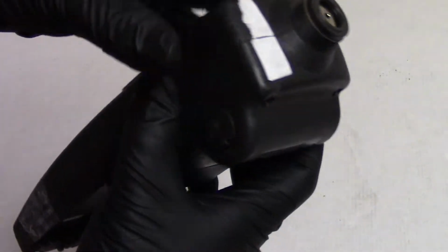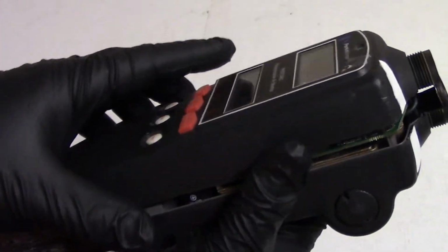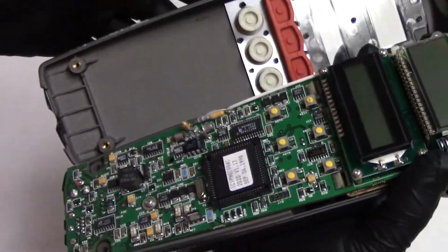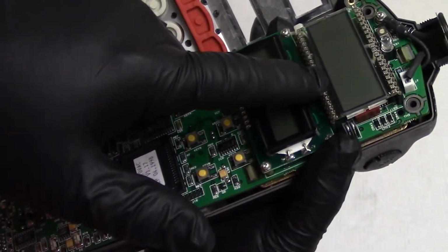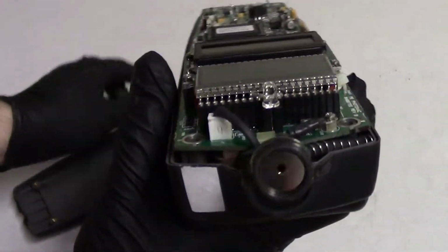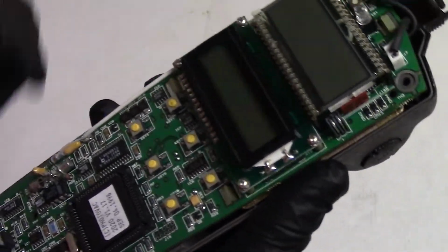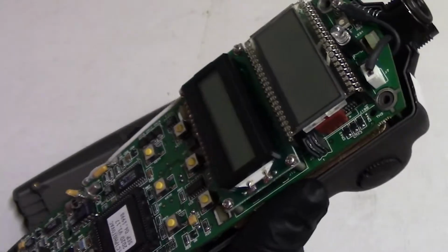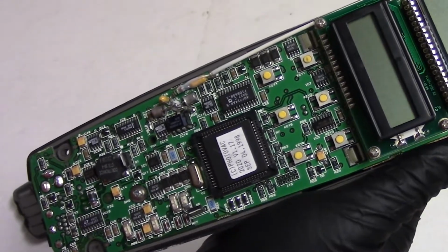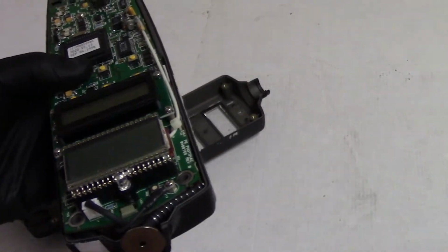Now, I've actually had this apart once just to kind of familiarize myself with things so that I didn't bumper around and fumble too much. But when I first took this apart, the LCD panel, there's our first view of the inside. This panel was sticking to here, and it pulled up and out, and a bunch of the legs that go into those sockets were actually kind of bent. So I think somebody else had it apart before me and didn't put it back in right. So I reseated everything and it was happy. But here's our first view. This is what 1998 technology looks like, or earlier maybe. Oh, we need that. I'm going to save that washer, or that O-ring.